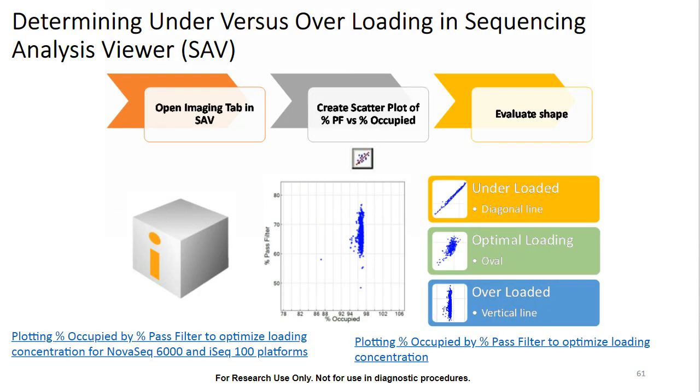Now, we talked a lot about underloading versus overloading conditions and percent passing filter and percent occupancy. So what we want to do here is show how we can graph these using Sequencing Analysis Viewer to create a scatter plot that looks at percent passing filter versus percent occupied. And this can help us differentiate between underloading conditions, optimally loaded conditions, and overloaded.